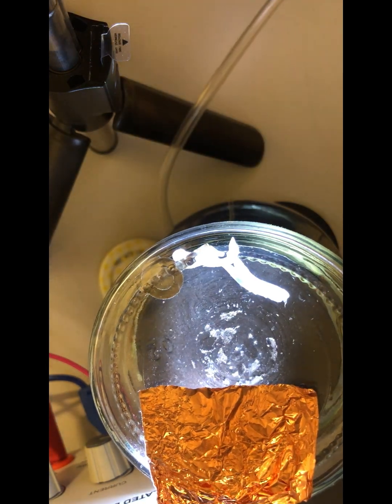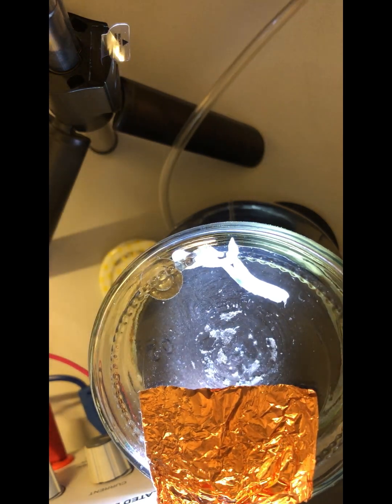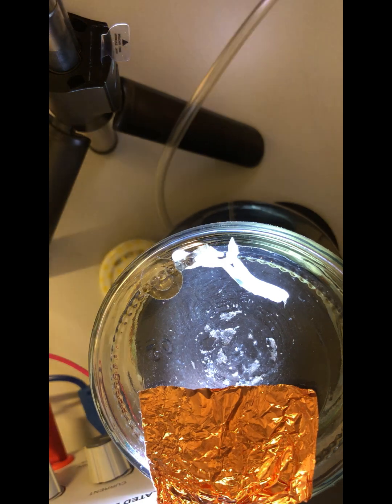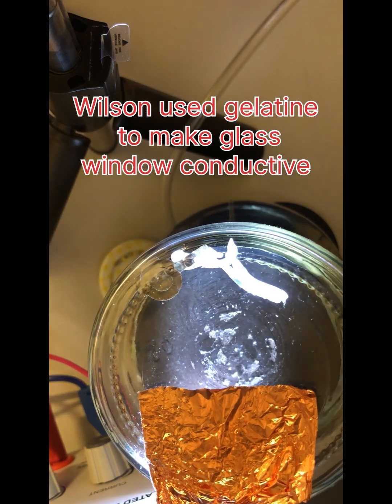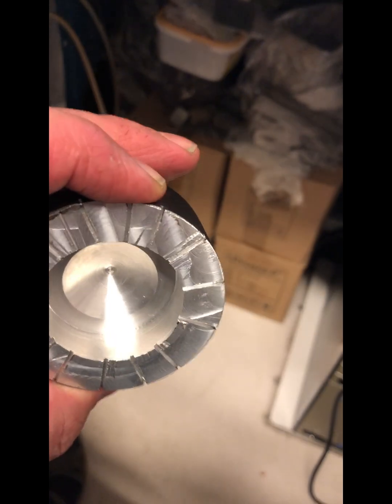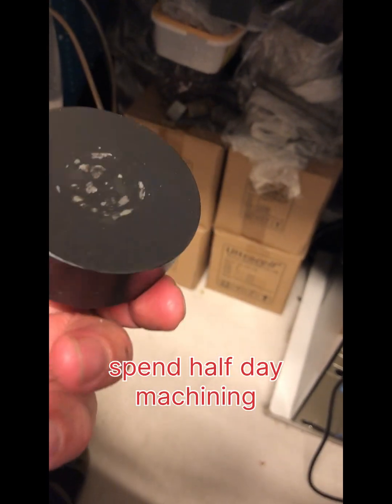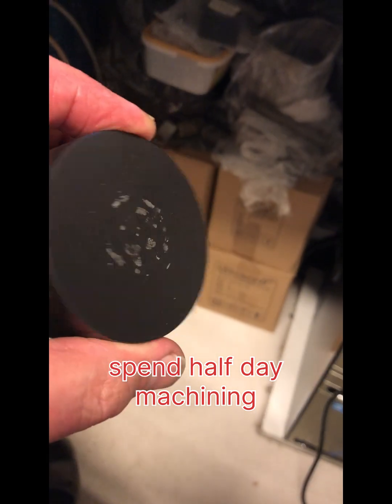There is a lot of alpha activity, and without this electrode, static charge builds up and smears the tracks, and no more tracks are visible without the electric field in a short time. This aluminum plate reduces the volume inside the jar and also distributes air more evenly.